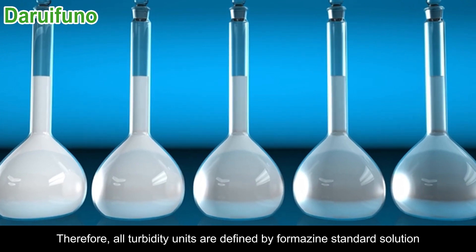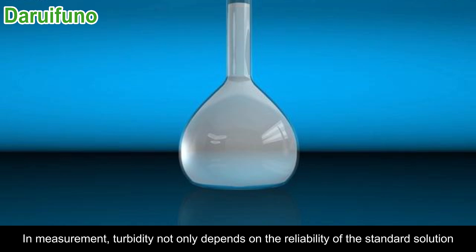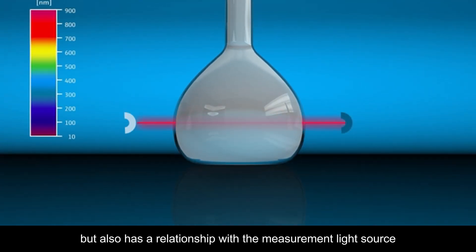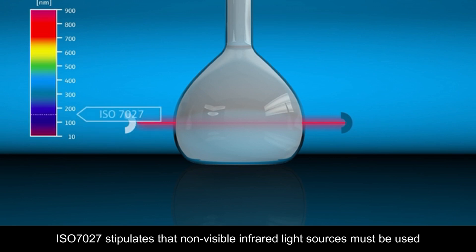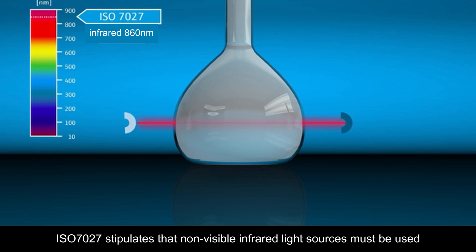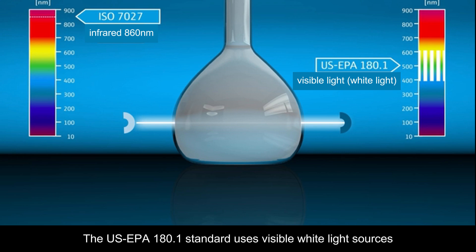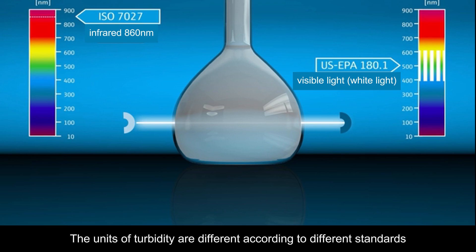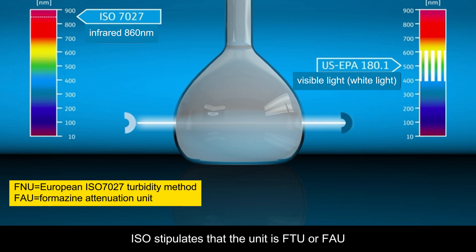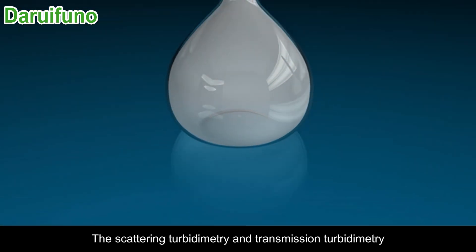In measurement, turbidity not only depends on the reliability of the standard solution but also has a relationship with the measurement light source. ISO 7027 stipulates that non-visible infrared light sources must be used, while the US EPA 180.1 standard uses visible white light sources. The units of turbidity differ according to different standards: ISO stipulates the unit is FTU or FAU, and EPA stipulates that the turbidity unit of the scattering method should be NTU.